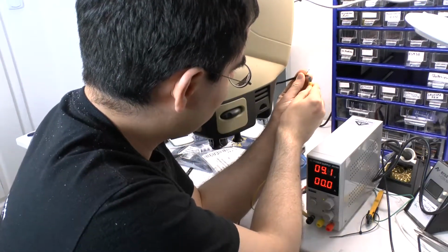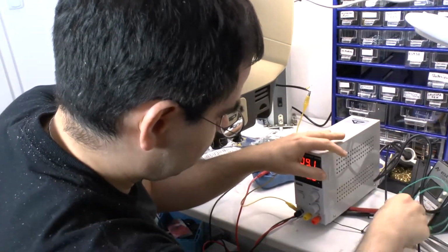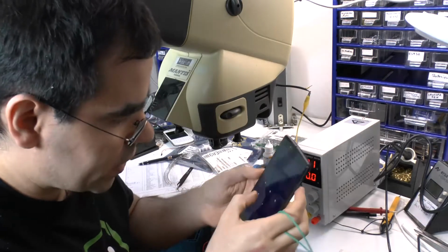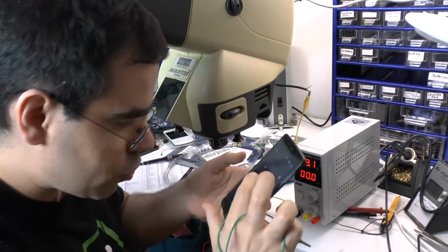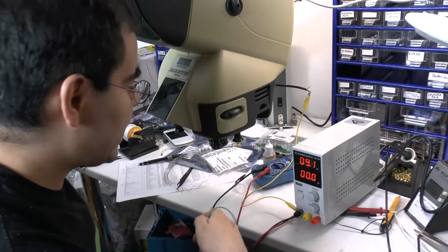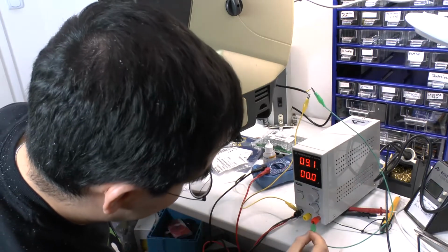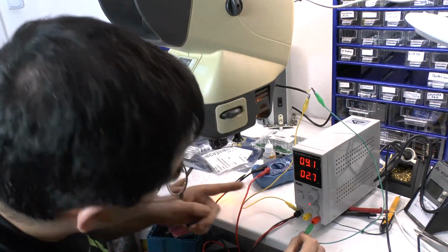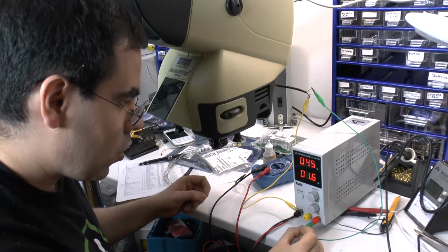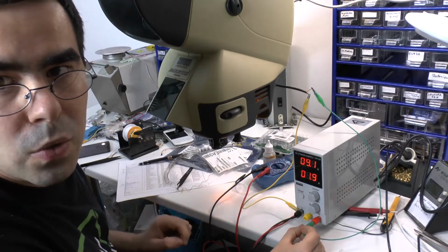Number one. I always turn on a torch in case I do something which might cause the power to fail in the building, so that in the case I'm not completely in the dark smashing up all the stuff. And now it's time to see what happens. And we get a huge amount of power being drawn and a small bit of light at the bottom. So, what are we doing now? We're gonna give it more power and we see, wow, we've got some light there.